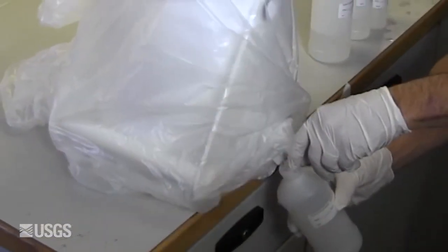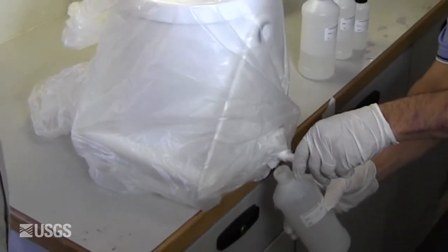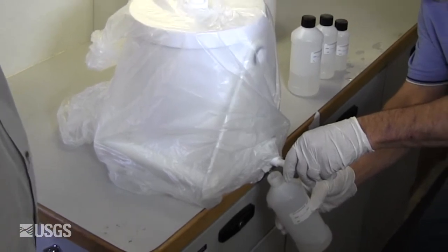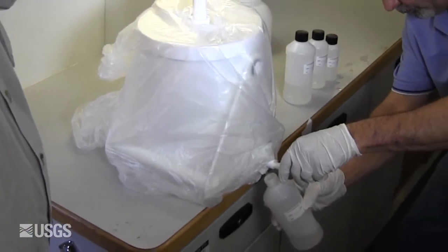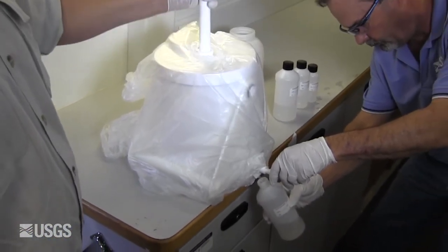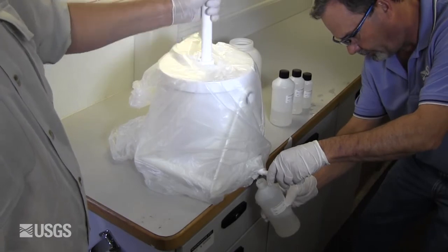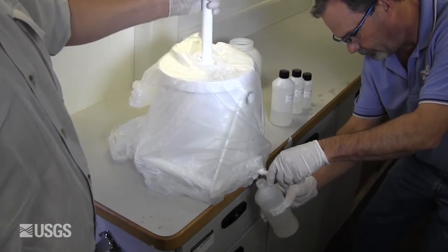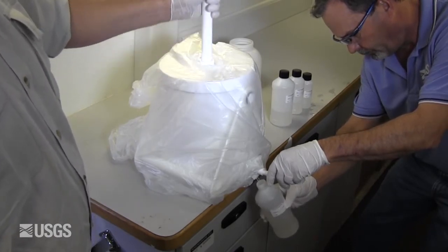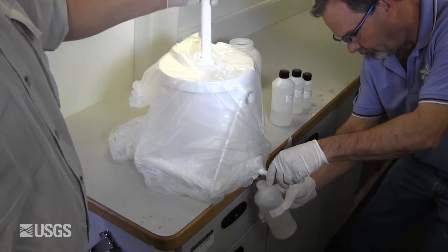As the volume of the composite sample in the churn decreases, adjust the stroke length to maintain a churning rate of about 9 inches per second and continue to avoid breaking the water surface within the churn.